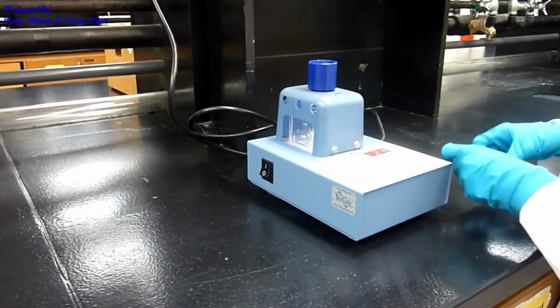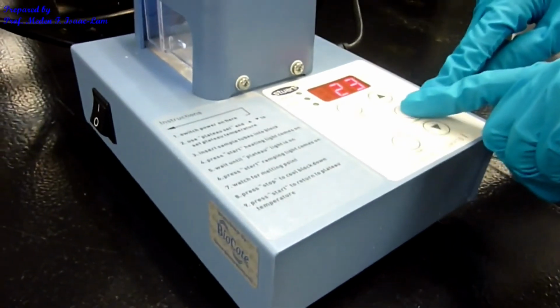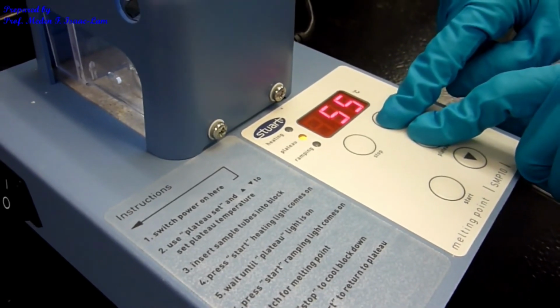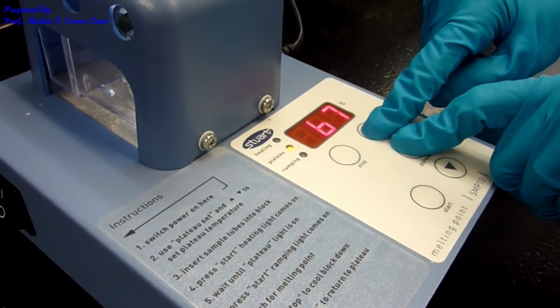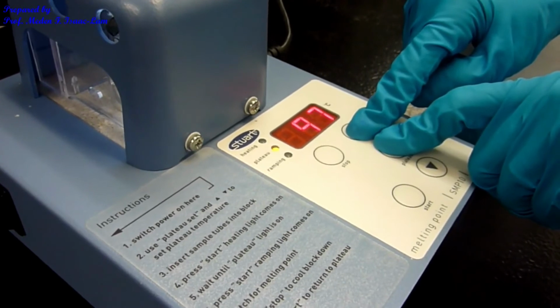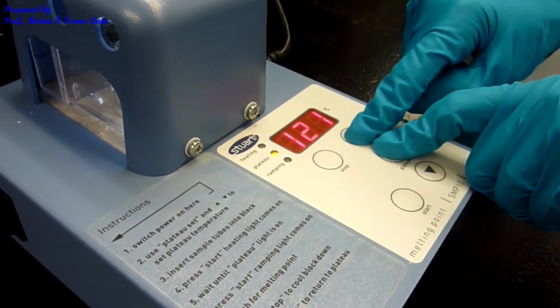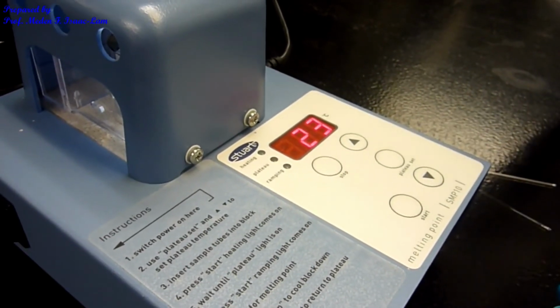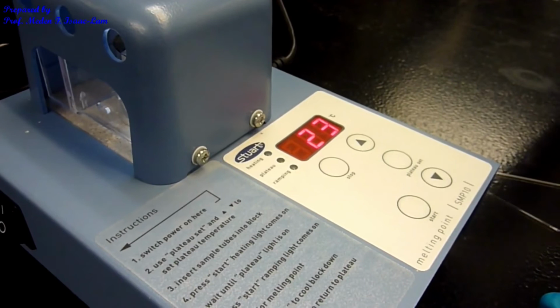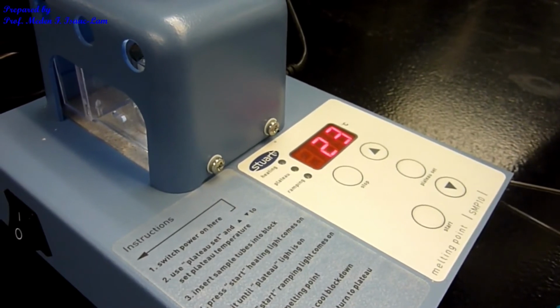So basically, what you do is I press the plateau. There's a plateau set in here, the middle button, and then I press it, and then I'm going to set it to 122. Okay, so that sets the peak of the heating block. If it doesn't melt at the temperature, I will increase it slightly, close to it, because sometimes if you set it too high, it might melt so fast. So I want to make sure that I'm not overheating.